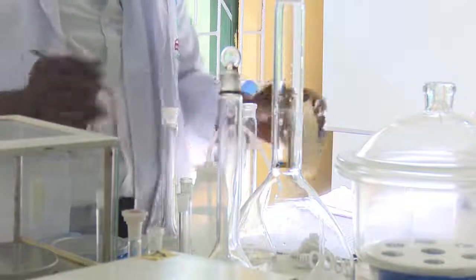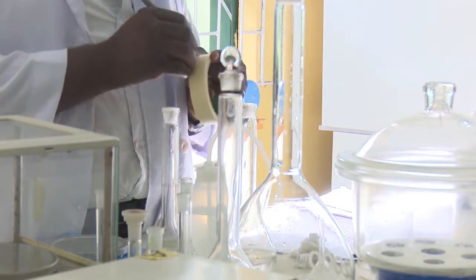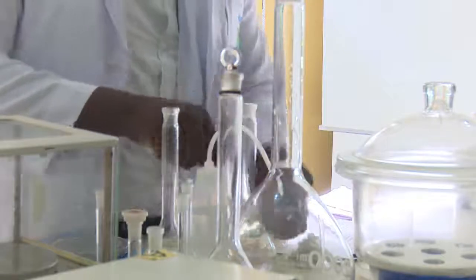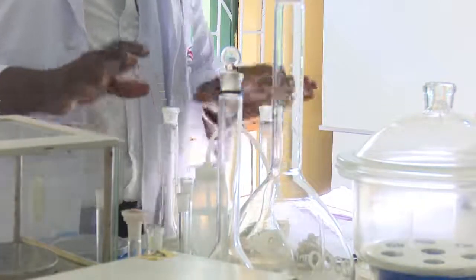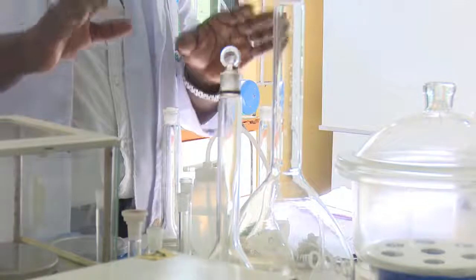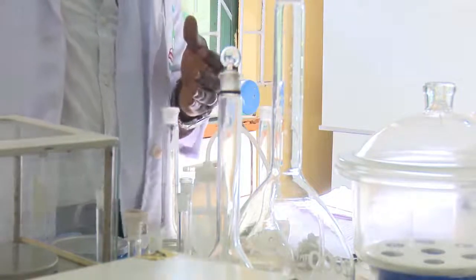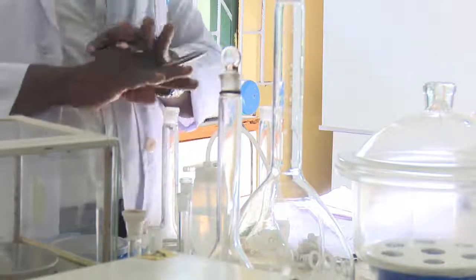What do you do next? The next thing you need to do is to label it 0.1 molar sodium carbonate. When you do that, you label it and keep it aside. So that is how serial dilutions of your higher concentrations are done in the lab. For other ones, if you use the formula given to you, you can achieve any dilution you want to make, because it is universally accepted. Thank you.